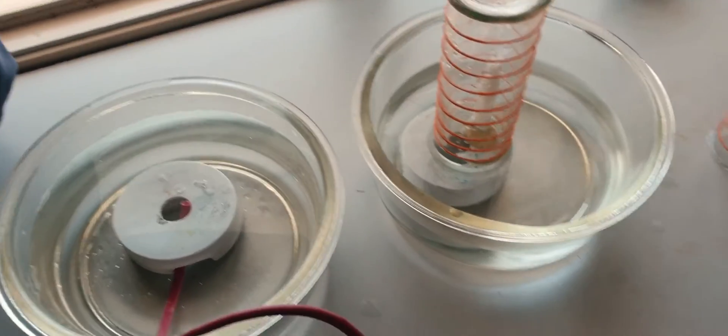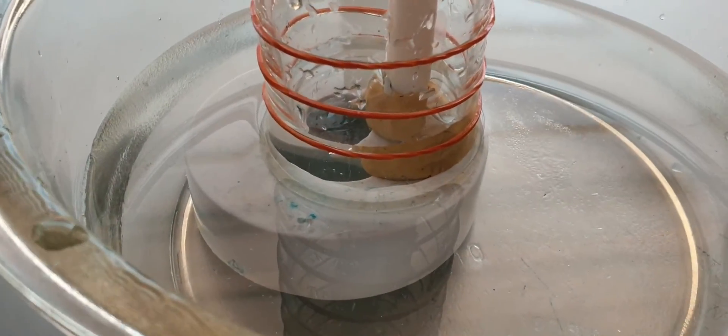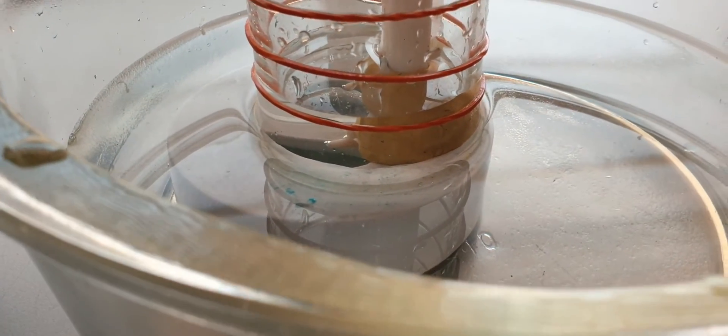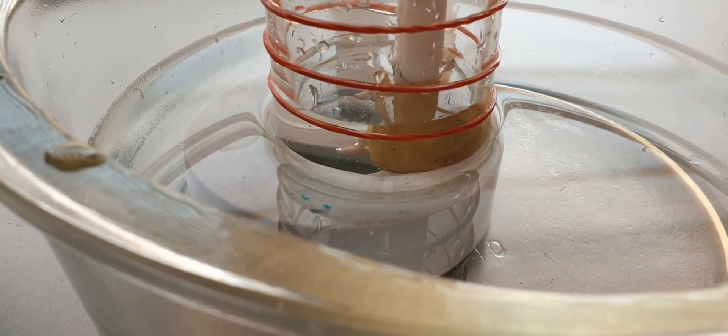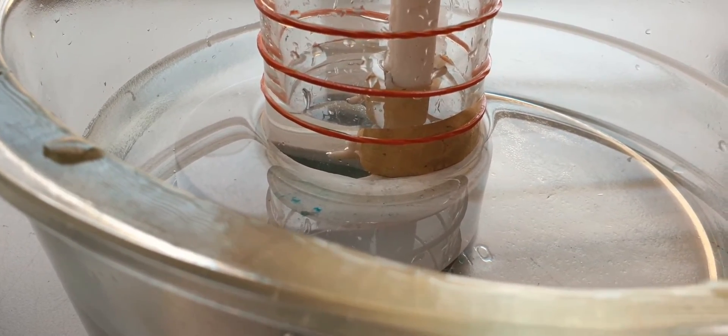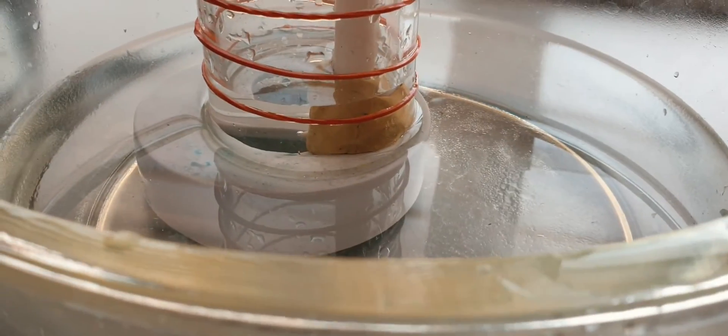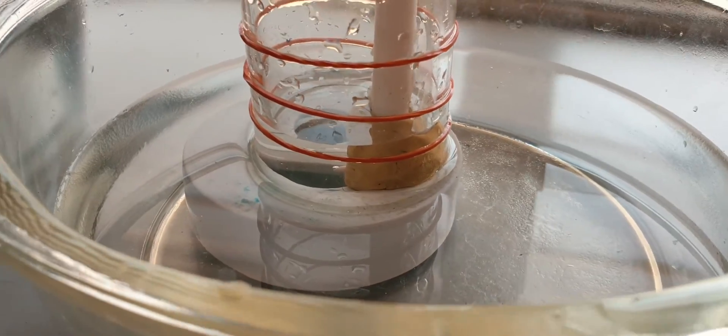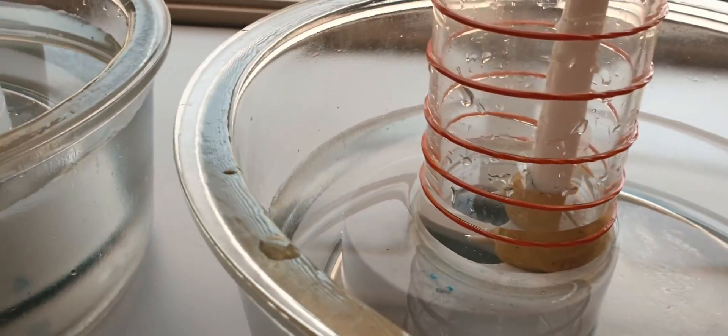You can see the water is rising up. The water rises about just a little bit higher than the first level. It's about one and a half.